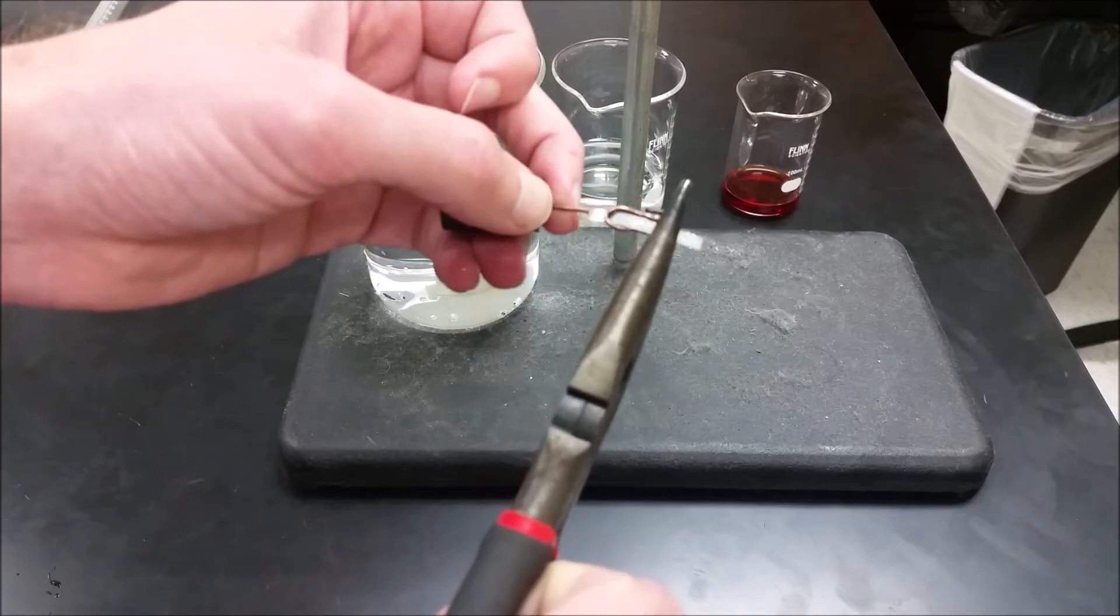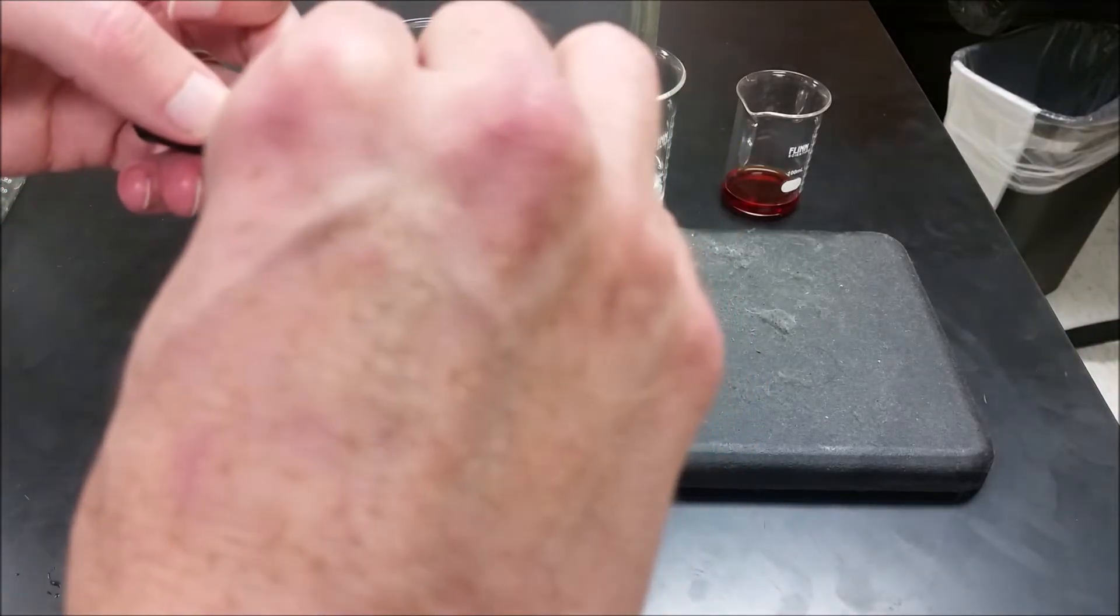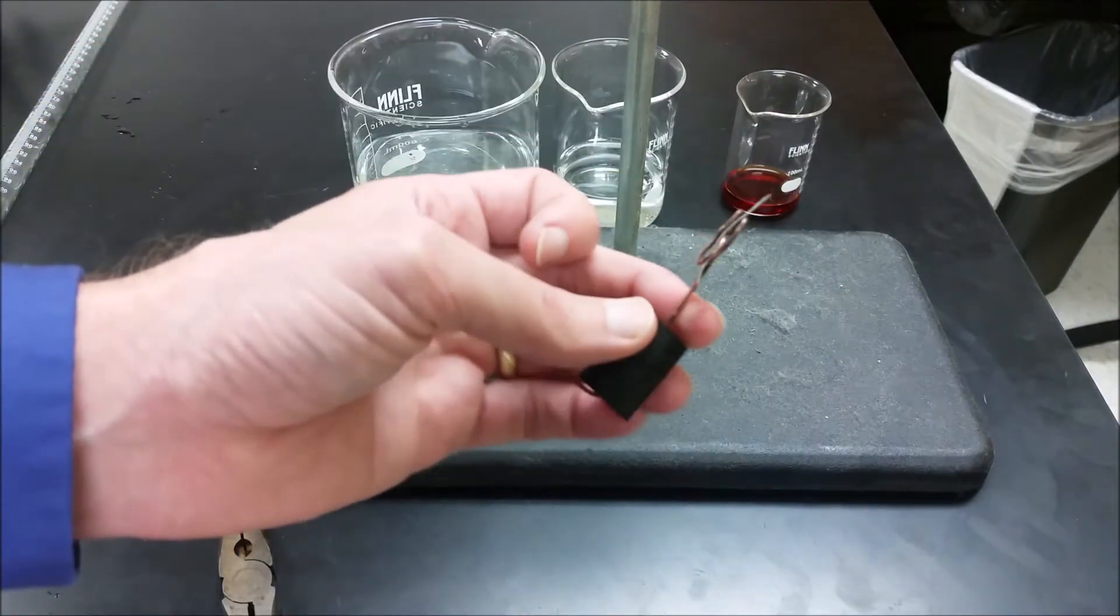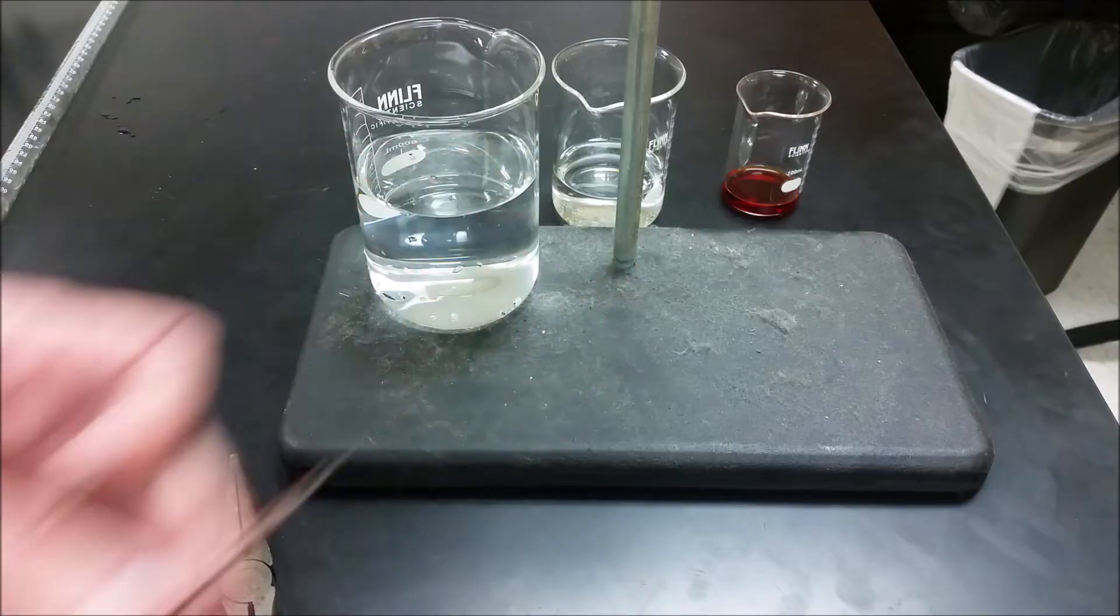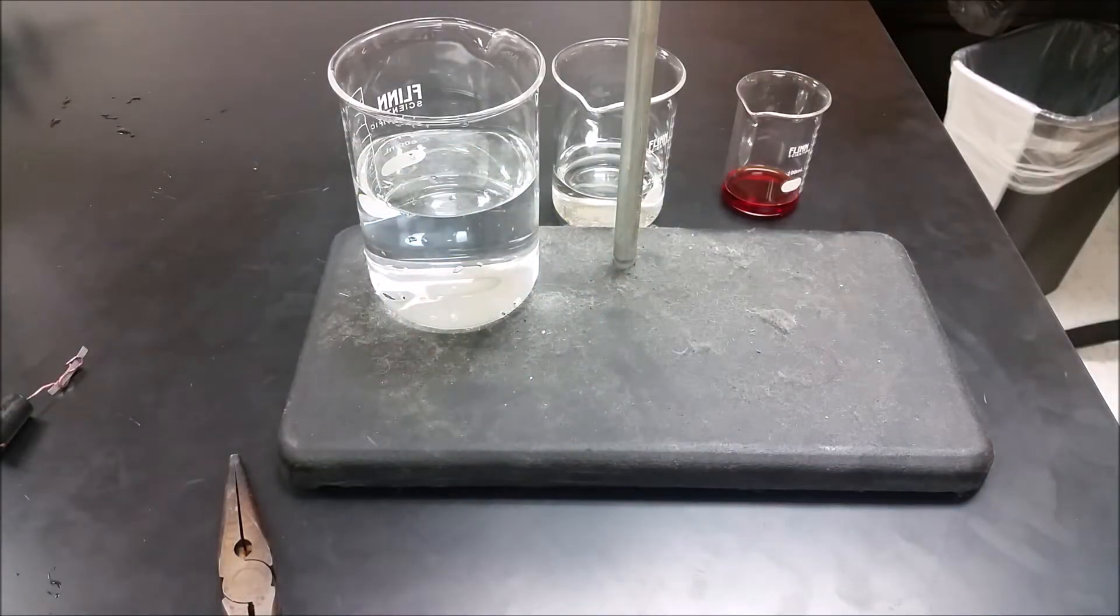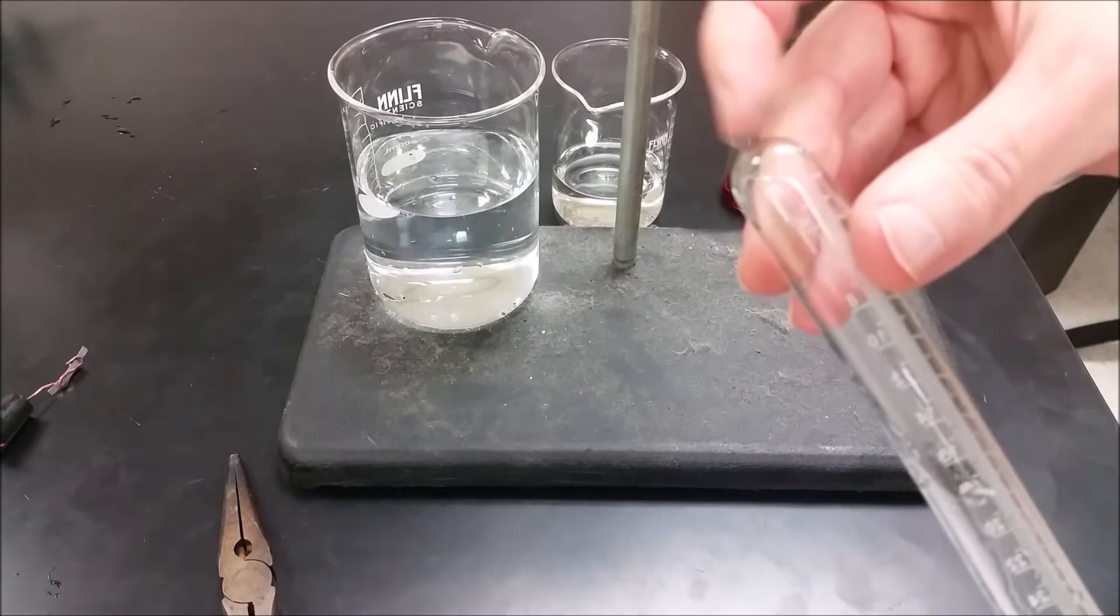Just give that a squeeze and that'll hopefully hold it where it's not going to rise to the top as the bubbles go. Now let's go ahead and look at the eudiometer. The eudiometer is open on one end and closed on the other.